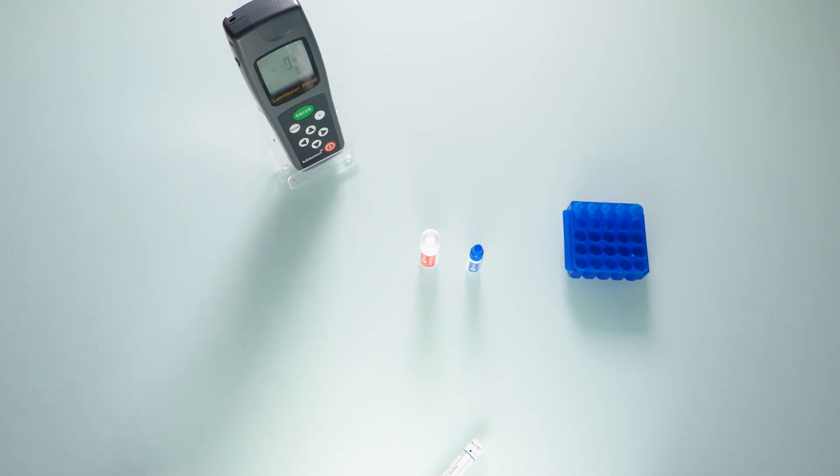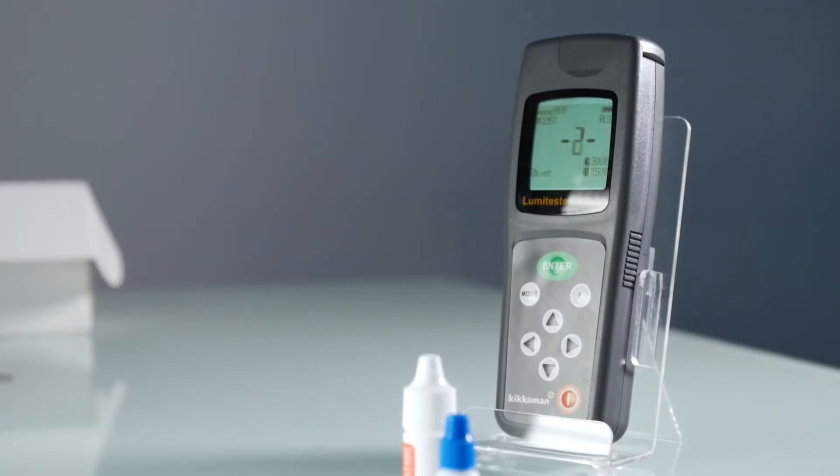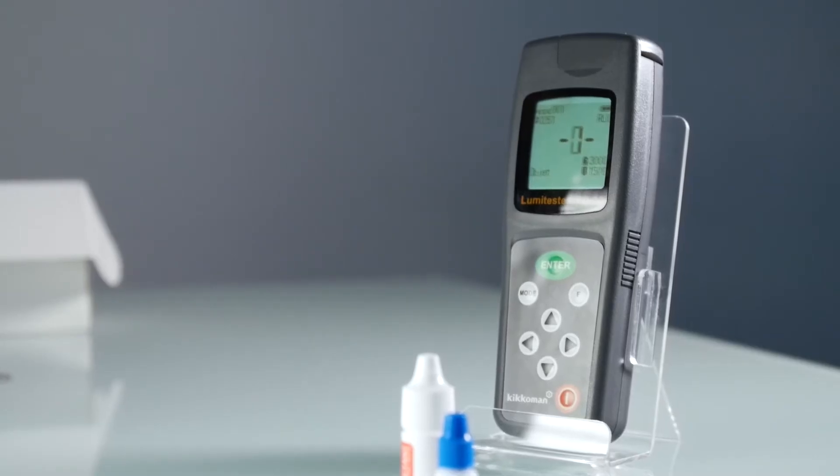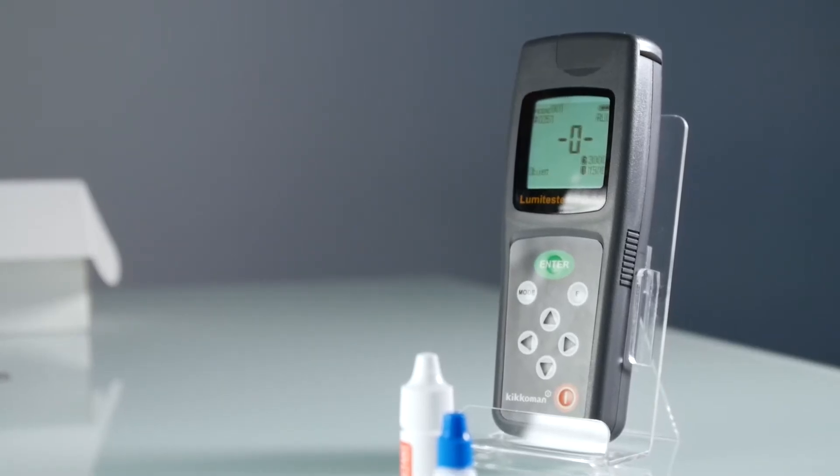The result, referred to as value R1, will take 10 seconds. Note it down.